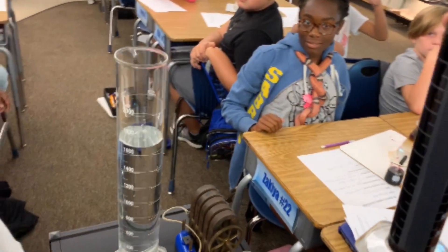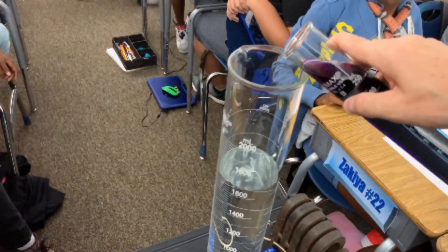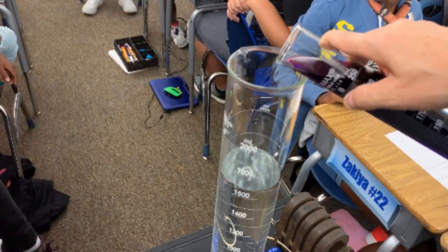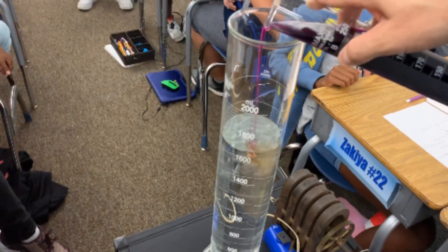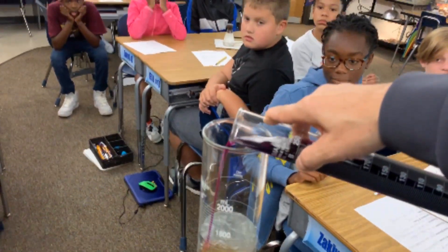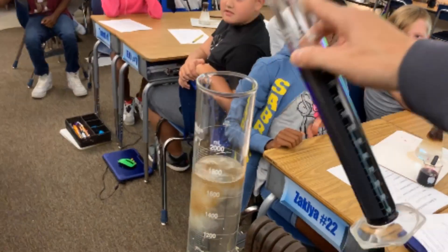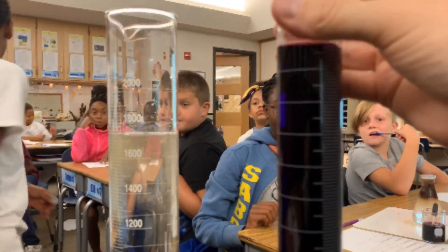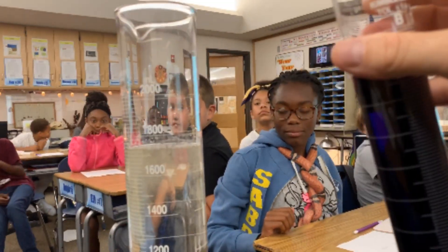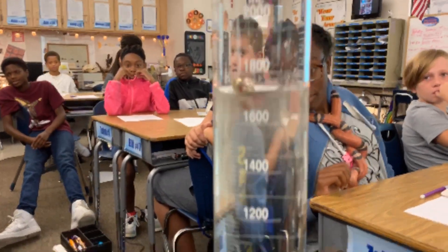Okay, let's go to the next. Again we've got our potassium permanganate, we're going to add it to our hydrogen peroxide, and we want to see if it becomes clear, so we're going to do this slowly. Where does the color go? Isn't that weird? Let's look — is it clear? Okay it's becoming clear, but look — this is the color that it was. Let's keep watching, let's see how much we can add.